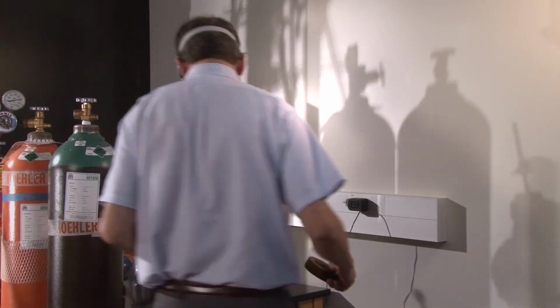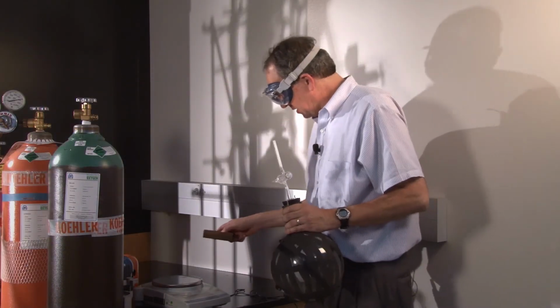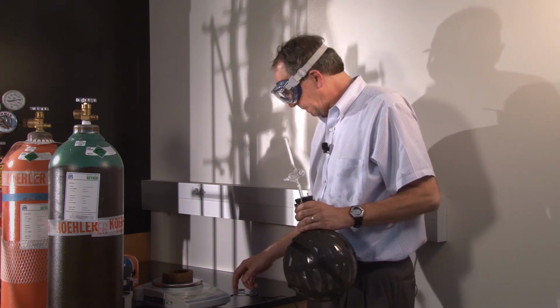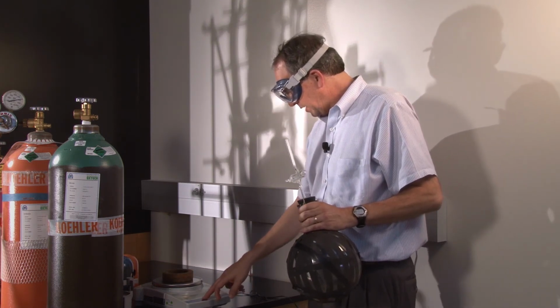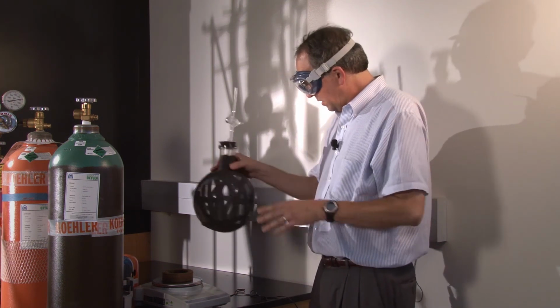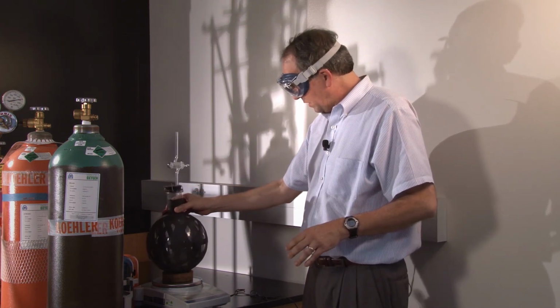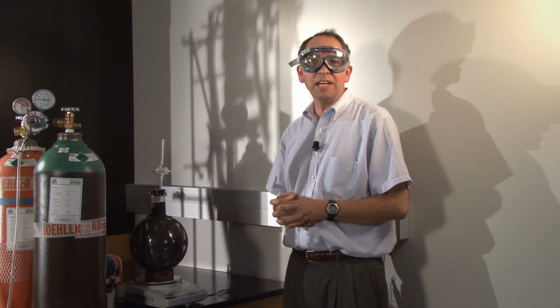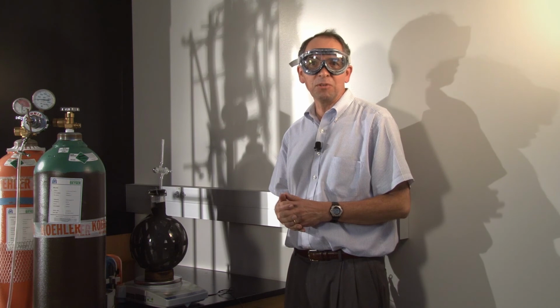All right, we're going to weigh the bulb once more with nitrogen. And we zero the balance with the ring on, and then we weigh. All right, that's the last procedure we're going to do for this, and you'll be doing the calculations that are indicated in your lab manuals.